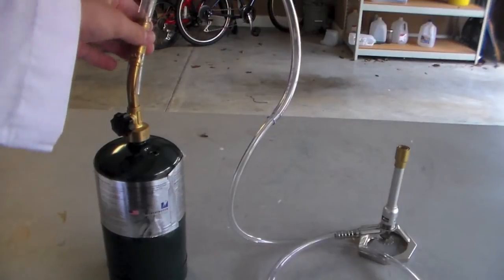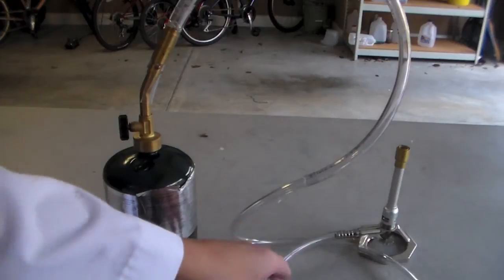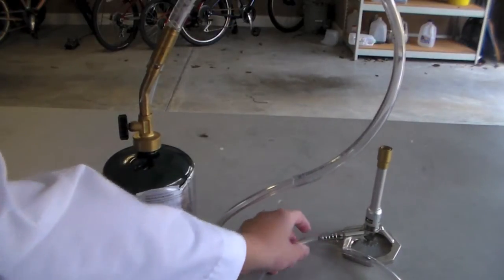Anyway, connected to this tubing is some more tubing, as you can see, which flows around, wraps around, and ends up going into the burner.